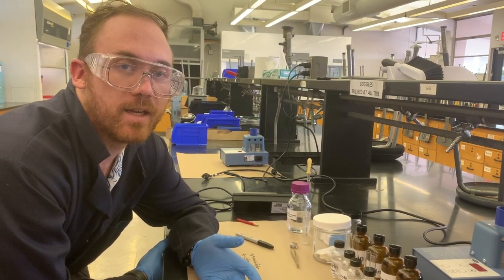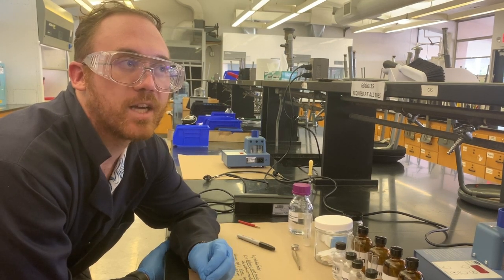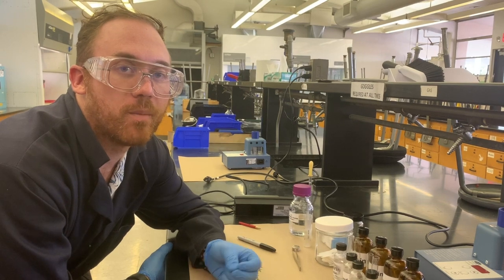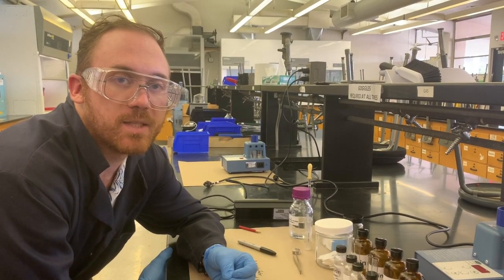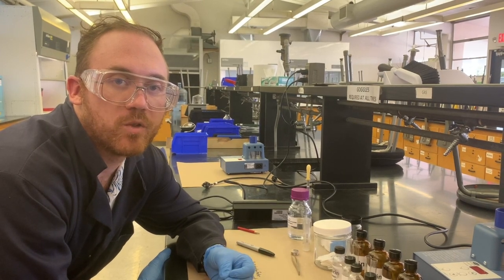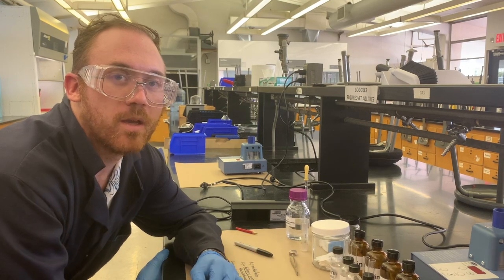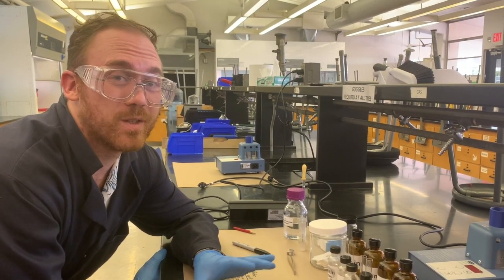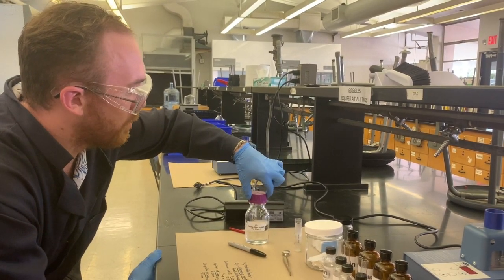The smaller those individual blobs are, the easier it will be to calculate the RF. You're going to have to decide whether you measure from the bottom, from the top, or from the middle of that spot. The smaller the spot, the closer those three possible points are going to be to the same. And when they're the same, it's really easy to have consistent results if you're using exactly the same mixture of solvents.